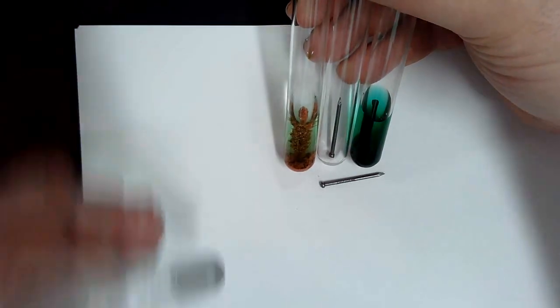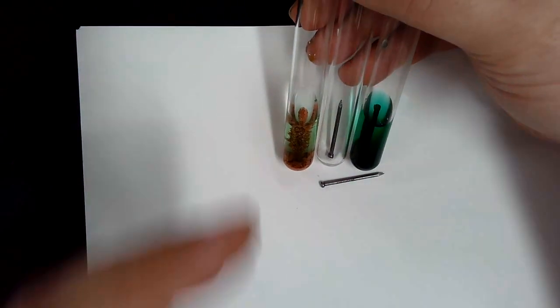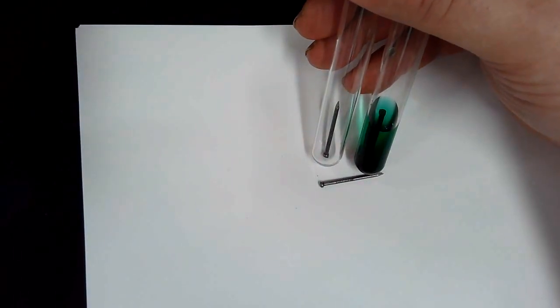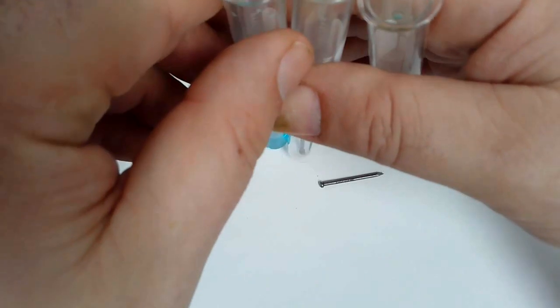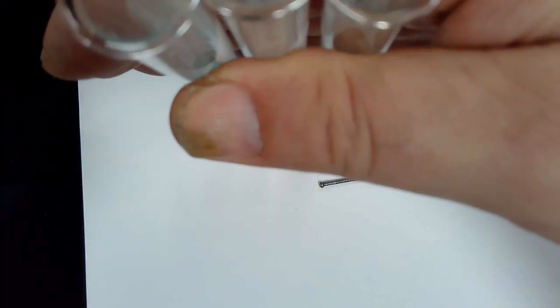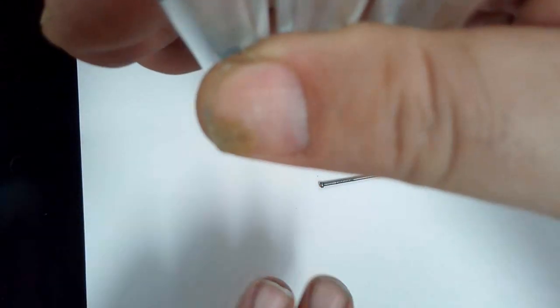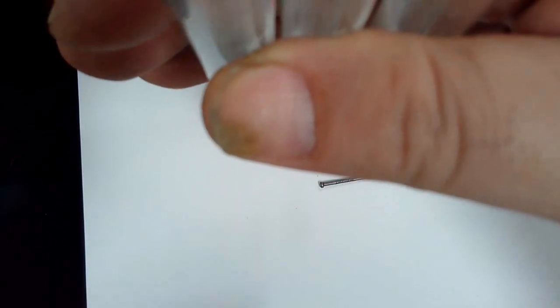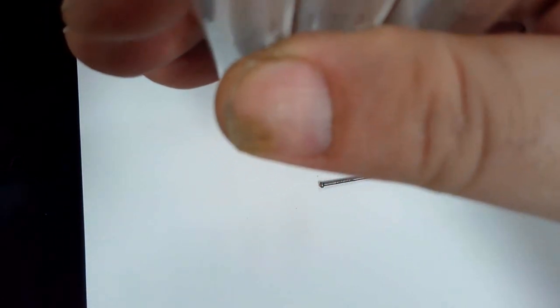Yeah. So as we go through the period, you guys are going to need to get some more observations of yours especially. I recommend that you go by the hood, grab these 3, just like this, put it inside of the hood and take your picture of the 3 just like this compared to each other. That way you're not getting any students' faces in your pictures. You can take that picture and you can put it into your observations. Everybody have that? All right.